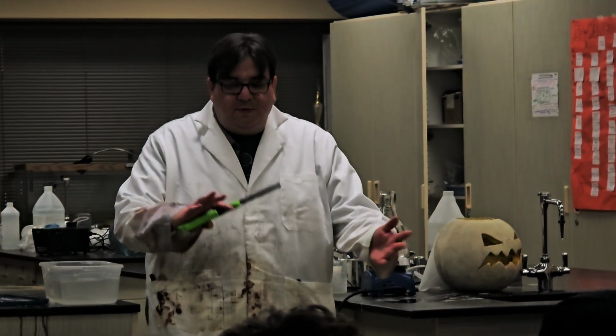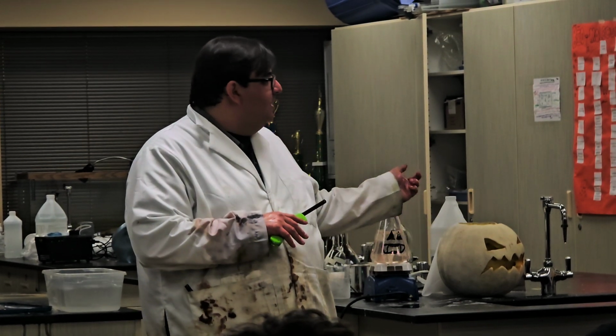You were just on fire! Okay, my hand. Yep, try the other hand. Yeah. Maybe the other hand is more burnable. I was having a problem with it being burnable yesterday too. Oh, there we go. There we go. So one of the things that you'll be able to do is light your hand on fire, okay, so that's one of the things that you'll be able to do.